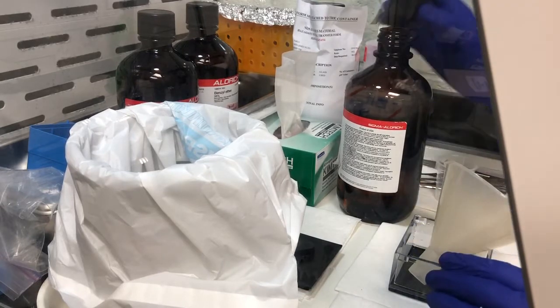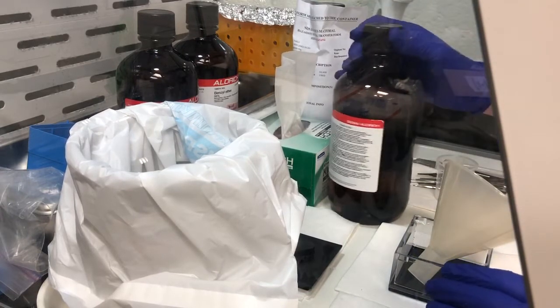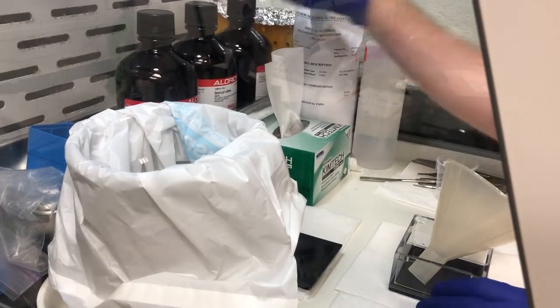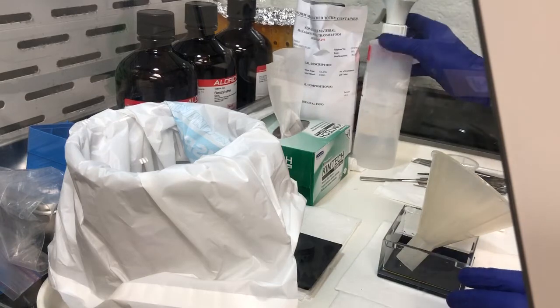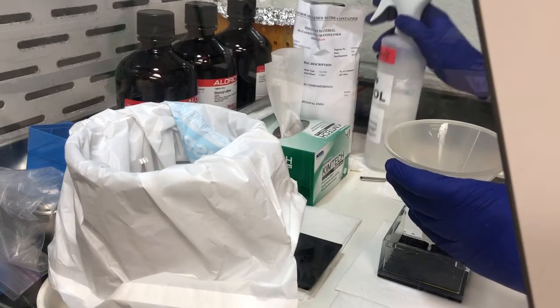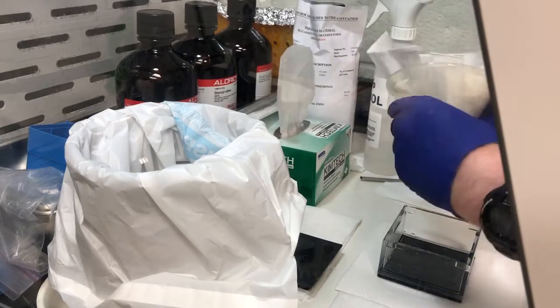So then I put the lid back on. Then we have to clean the funnel and clean this, and that's all with ethanol. So I typically spray the funnel with a little bit of ethanol, use Kimwipes to wipe it down.